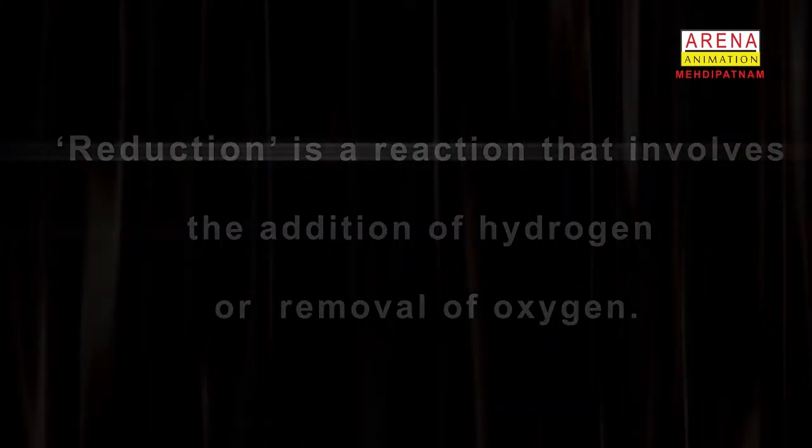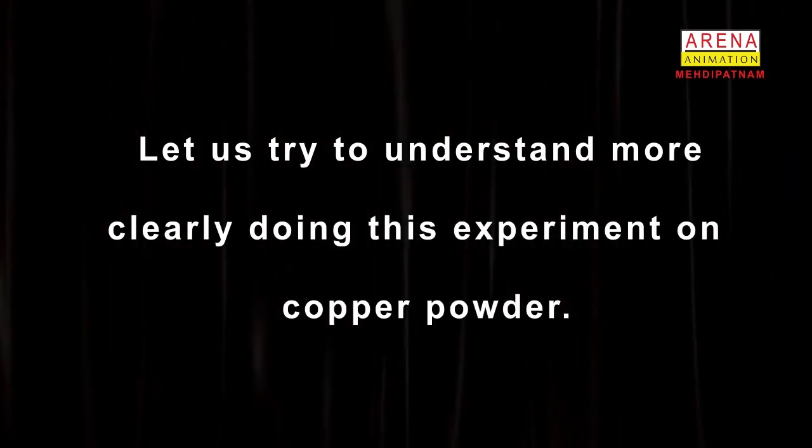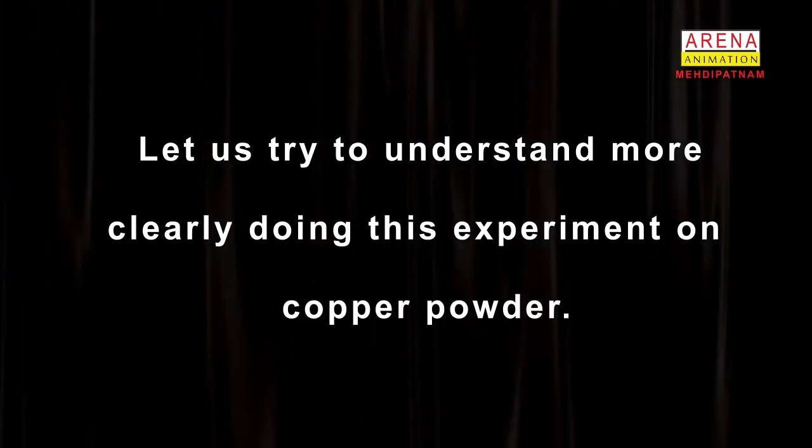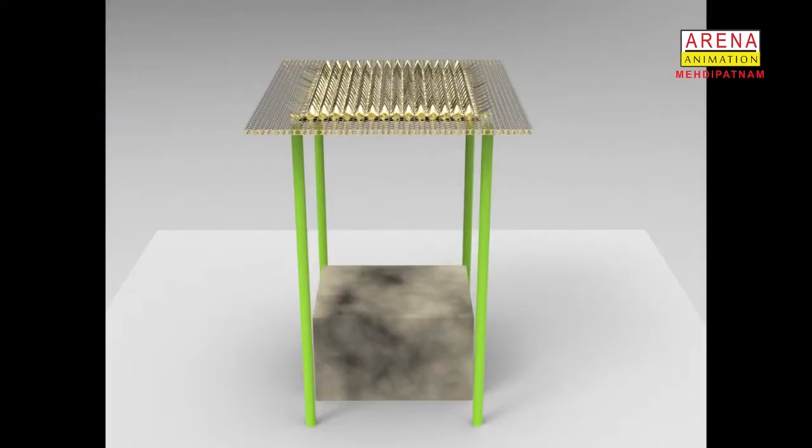Let us try to understand more clearly by doing this experiment on copper powder. Procedure: take a tripod stand and place the wire gauze on the tripod.